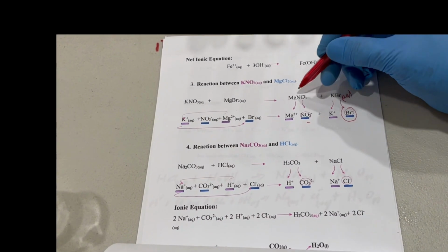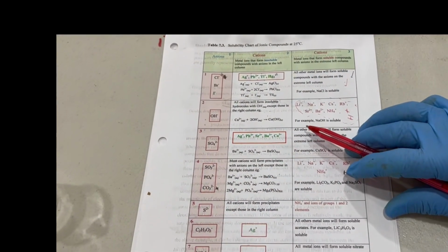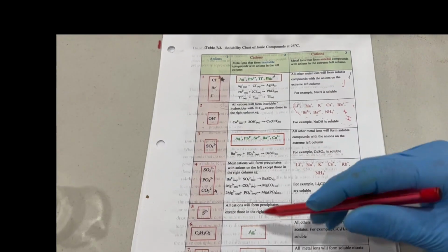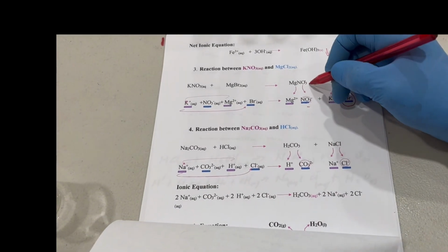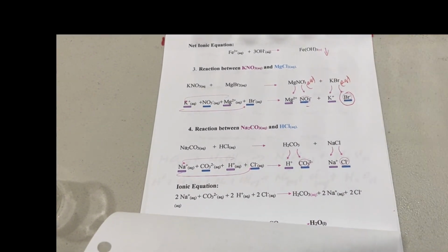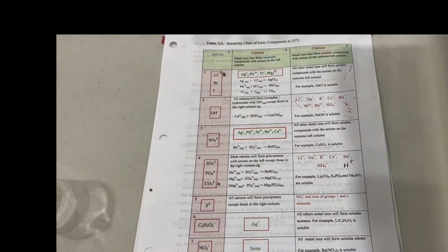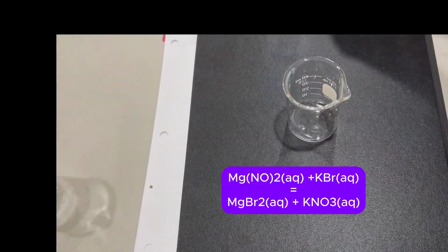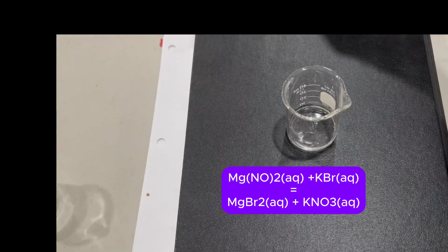Now we check the solubilities of nitrate, magnesium nitrate. Go to see where nitrate is. Nitrate is down here. Nitrate is right at the bottom. And you don't have any cation that forms a compound with nitrate. They're all soluble. So what we say now is that this is also aqueous. So when you mix those two, you expect not to have any precipitate. Let's try that out there and see what happens. Here, expect no precipitate to be formed. Nothing at all. You see that? Okay, so predictions are going nice.